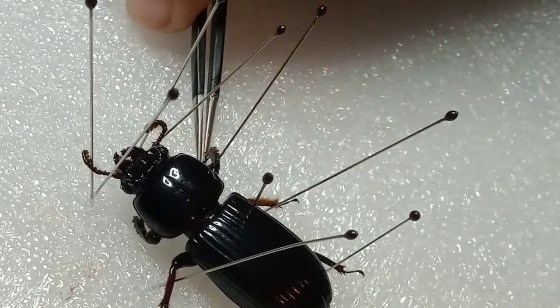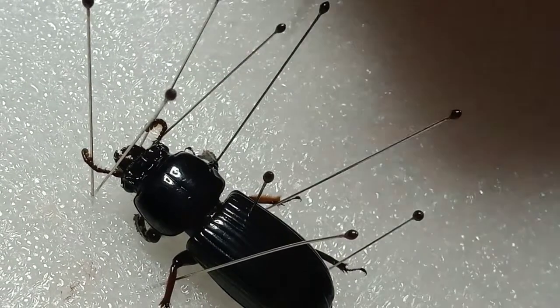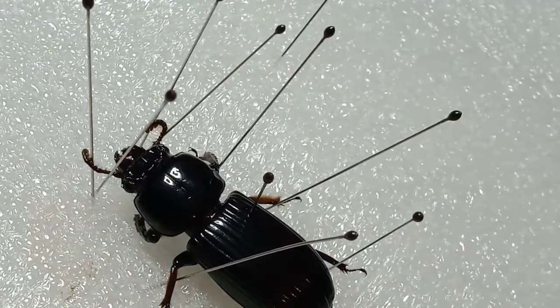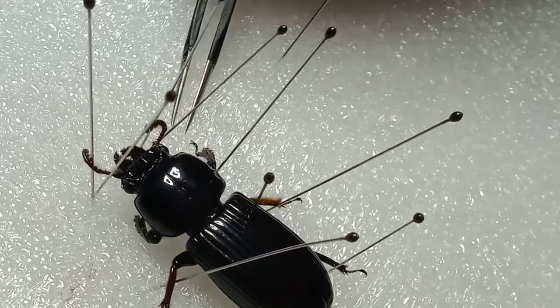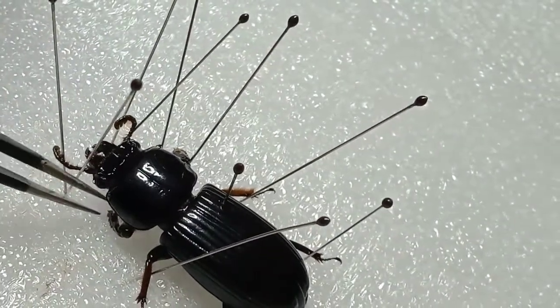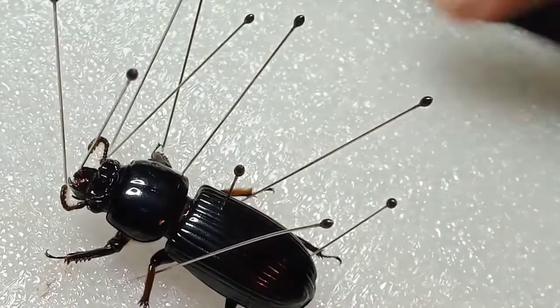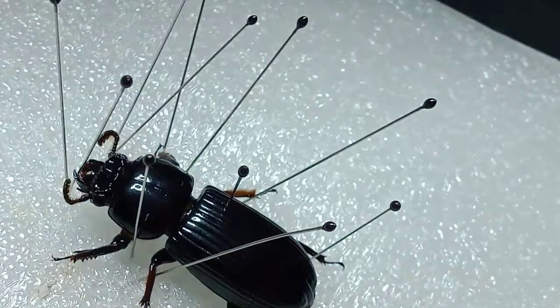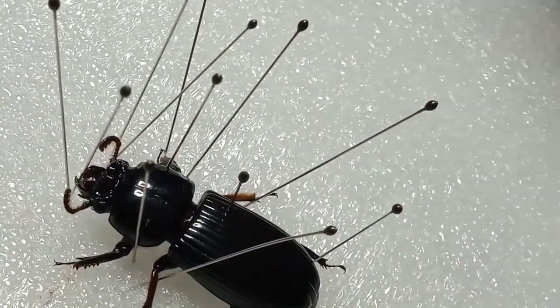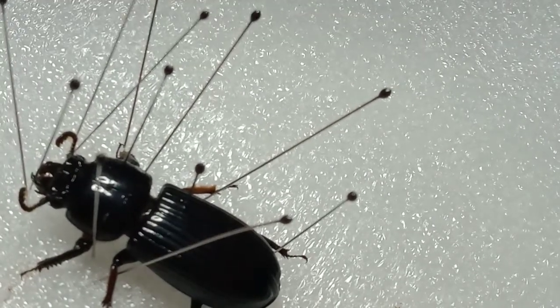Now you also want to make sure the second pair of legs are neat. You want to make sure the insect looks nice and neat to make it look alive. Now, to prevent it from spinning around, I figured out — you put two pins on the side, so it won't spin around. Make sure they all look nice and neat.